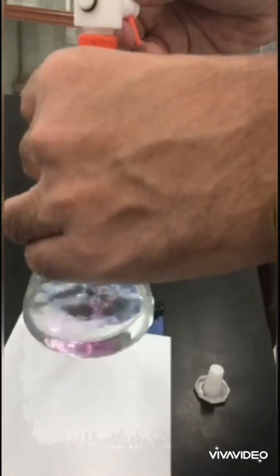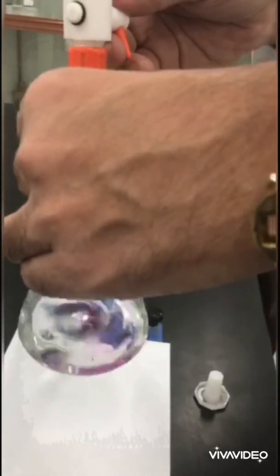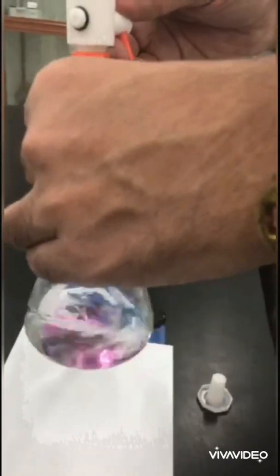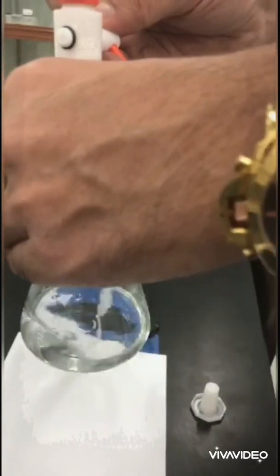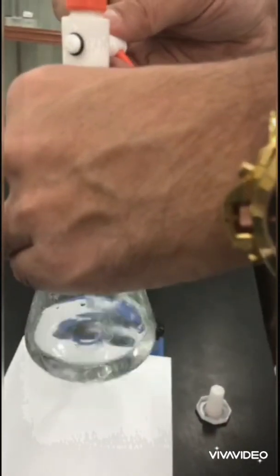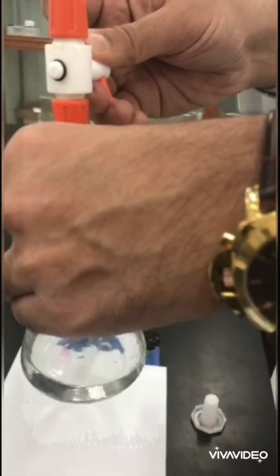Now we are still adding the sodium hydroxide and we are waiting until the entire solution becomes pink. I think we are very close because the pink color appears and it disappears slowly. This means that we are very close to the endpoint, so we should be careful.